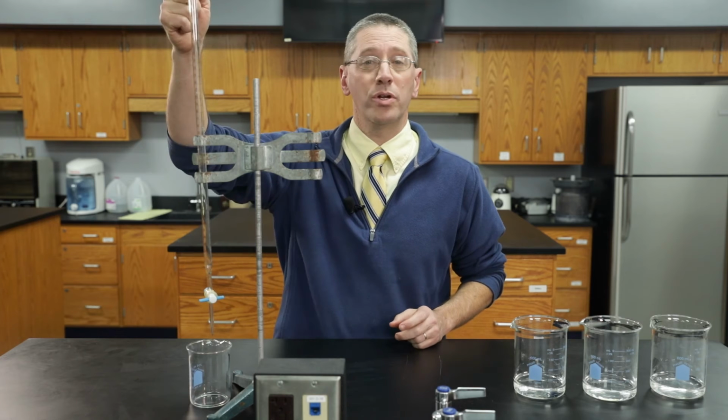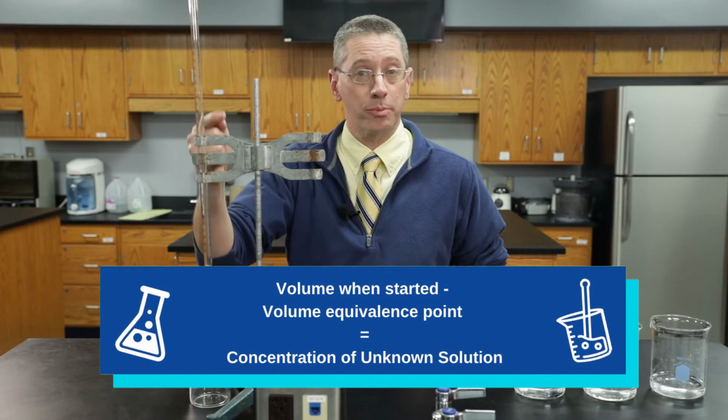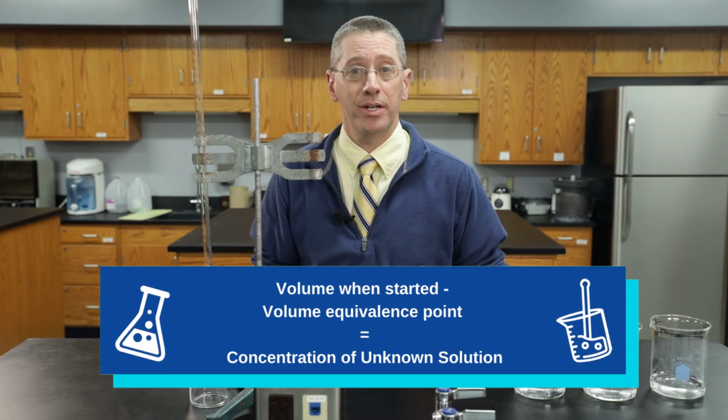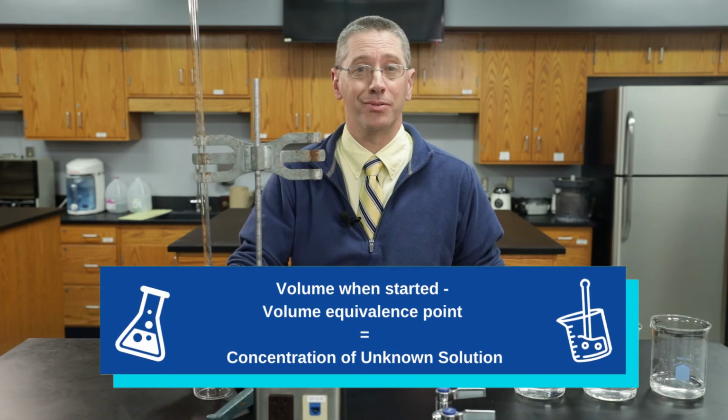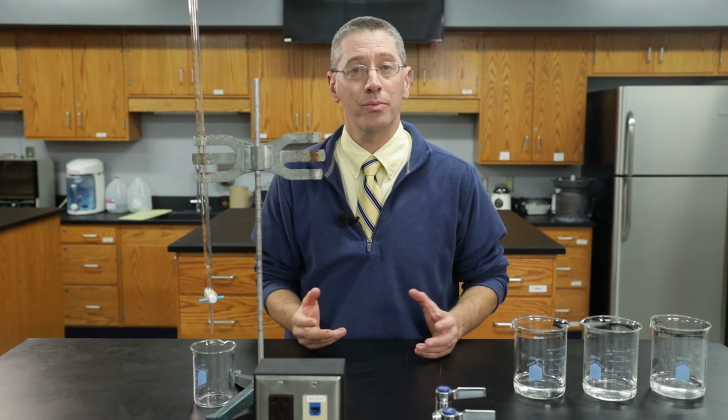If you know the volume when you start, and you measure the volume when you reach the equivalence point, you can subtract those two numbers and do the math to calculate the concentration of the unknown solution. Titration is one of the most common and useful labs that we do in chemistry.